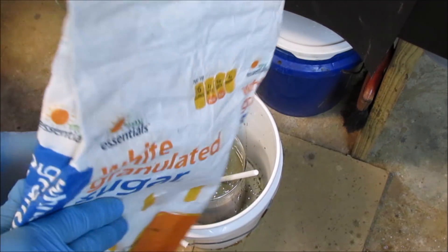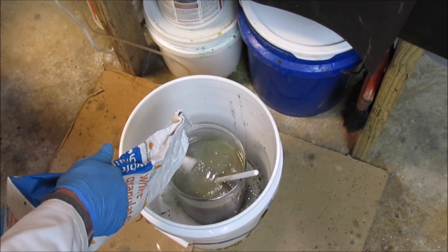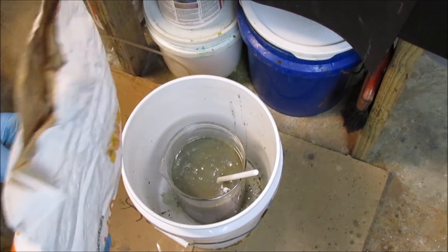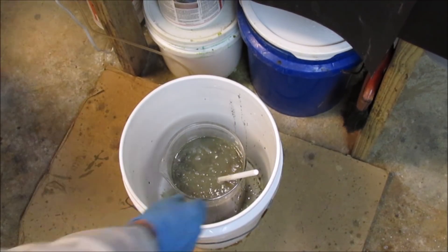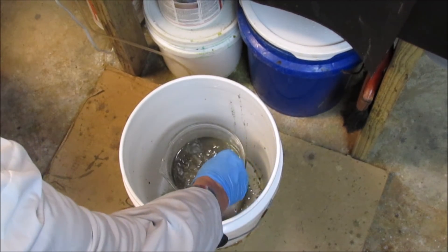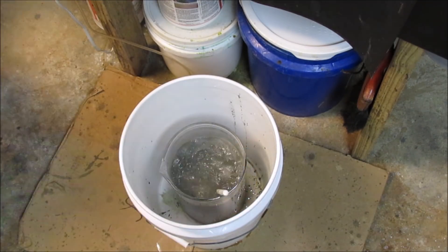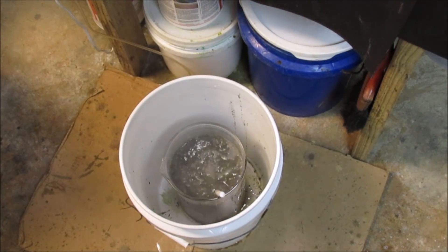Add a little more sugar here. You're gonna add just slow, or the reaction will really take off. Like that. There it goes.